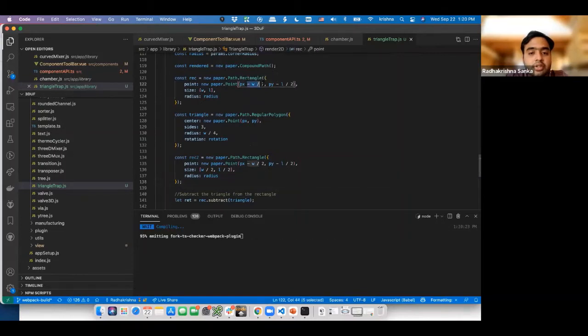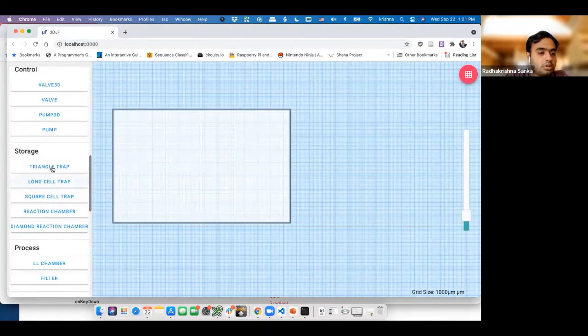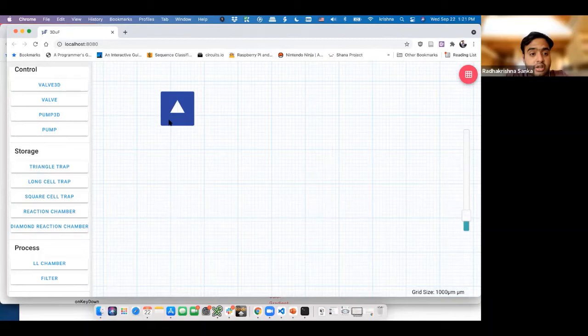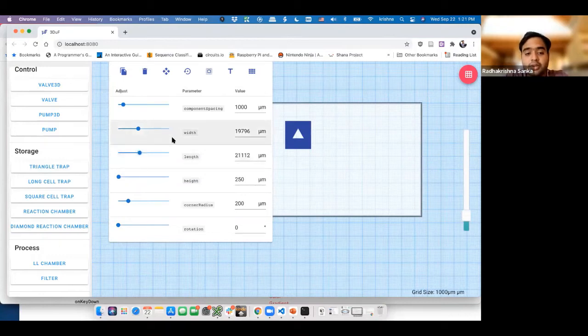So this one was, okay. I'm going to modify this slightly so it's easier to work with. There you go. So by just having this, now we have a triangle trap done. And now the best thing about this is because it's all computationally done, by just modifying the width and length, obviously it's not well thought out in that sense, but by just modifying the width and length, I'm able to modify this. And by modifying the corner radius, I can modify the actual corner radius of this thing.